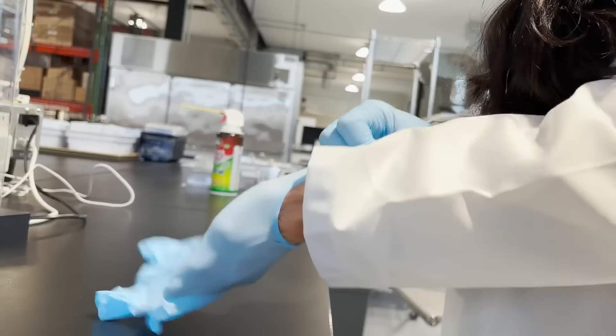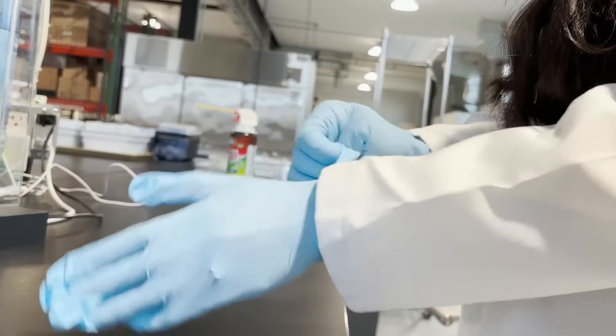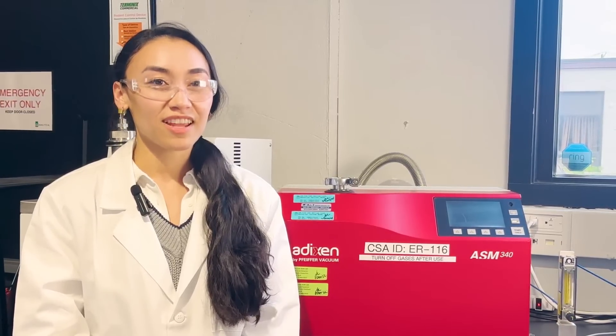Guided by USP Chapter 1207 and ASTM 2391, helium leak testing is a highly sensitive test method, typically used in upfront work to evaluate the inherent integrity of a package system, whether the package needs to maintain sterility, headspace, or otherwise.